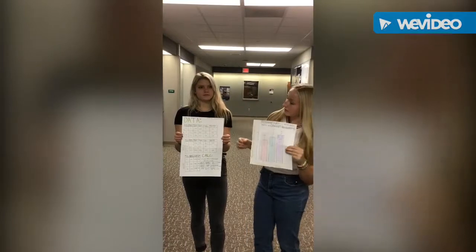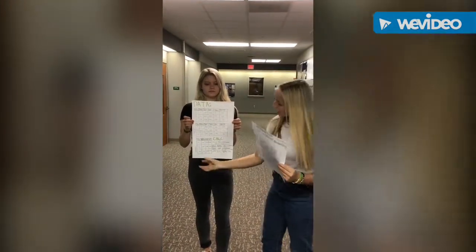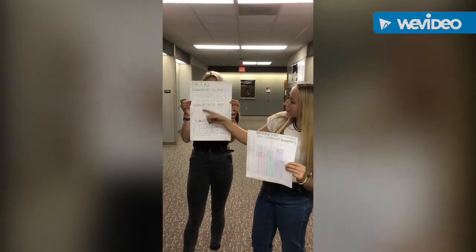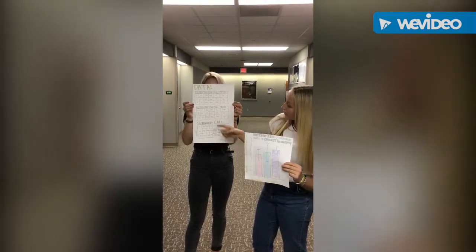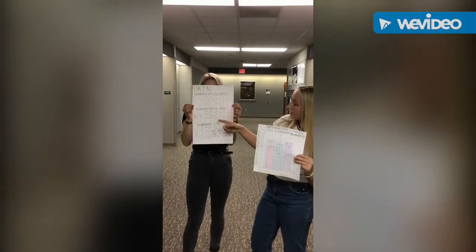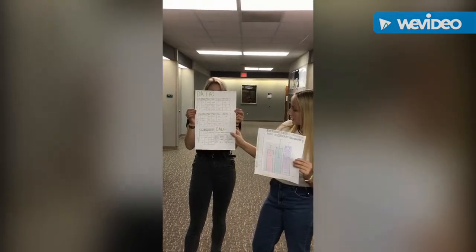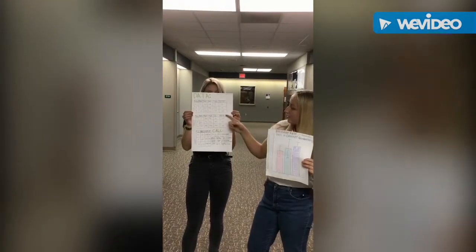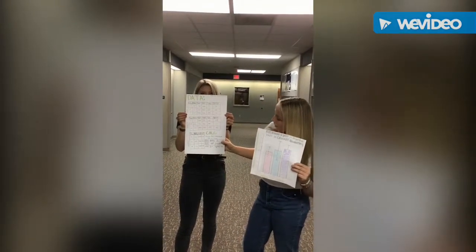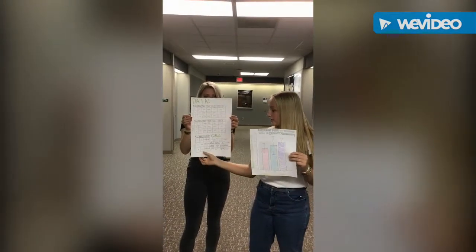And then the data table shows this is trial 1, this is trial 2, and then the averages. And then we have the number of crickets, the mass of each trial, and then the initial CO2, the final CO2, and the change in CO2, which is found by taking the final minus the initial CO2, which is indicated here. And then we have the rate of respiration, which is the CO2 gas over time over mass. And then we took the averages of all of these trials.